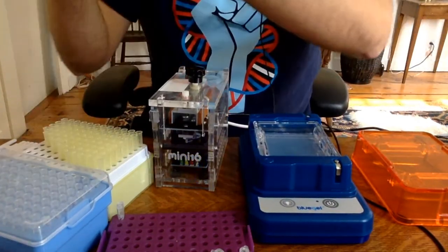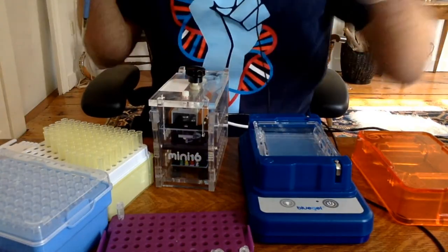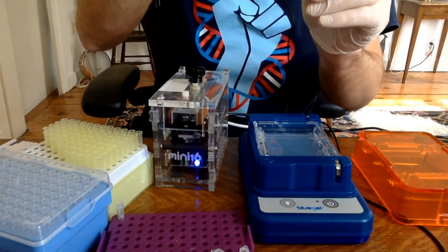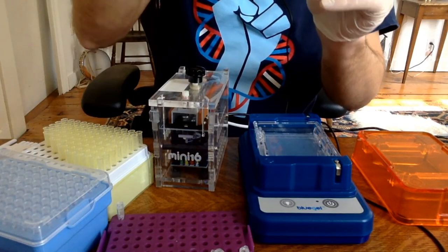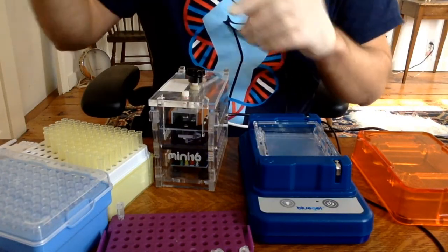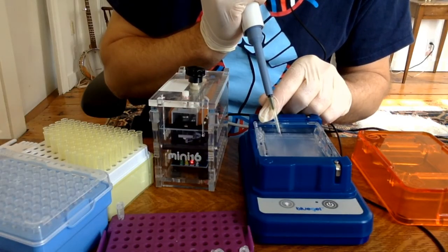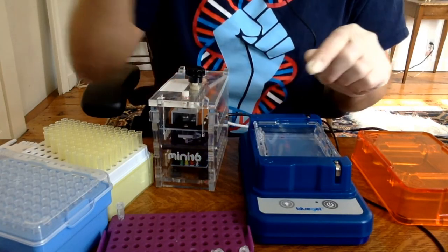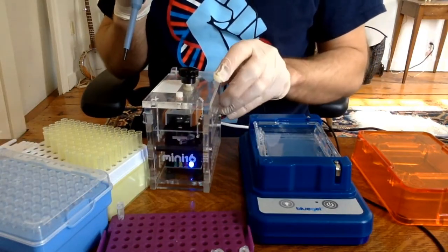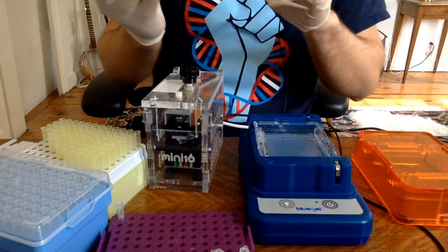For this, I believe it calls for 10 microliters of DNA ladder. So when you run a gel, the DNA will run at different speeds based on how big it is. So smaller pieces will run faster and bigger pieces will go slower. But how far they move through the gel is just relative, so you need something to compare it to. That ladder that I just put in is DNA of known sizes, so I can compare my results to something.